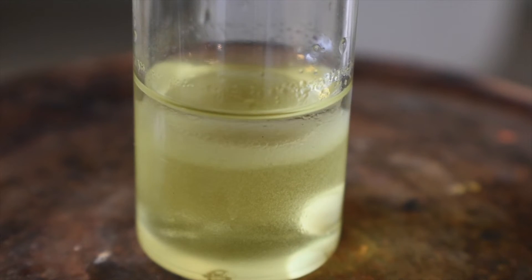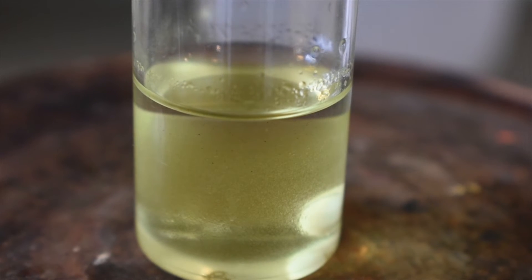As we can see, all of the green color has moved into the bottom organic chloroform layer. This means that our uranium-6 has successfully complexed. This means that I can go ahead and separate the chloroform layer from the aqueous layer. The aqueous layer probably contains little to no uranium left, as it's all been grabbed and pulled into the organic layer by the 18-crown-6. Let's get to separating those layers, shall we?